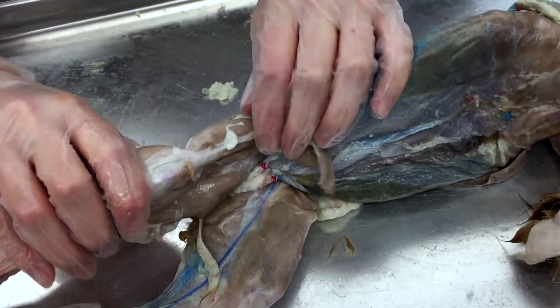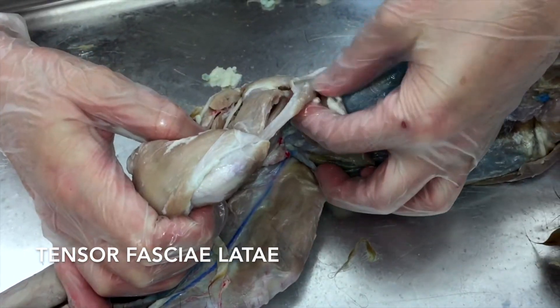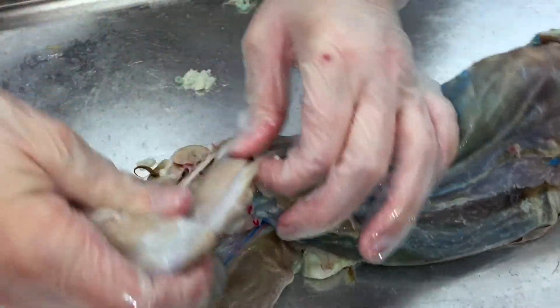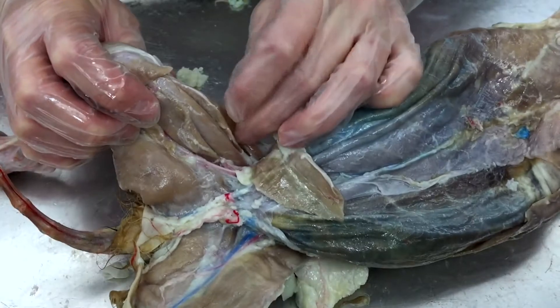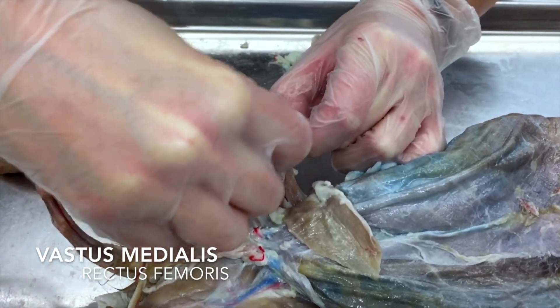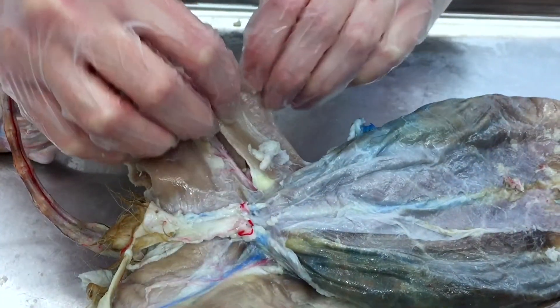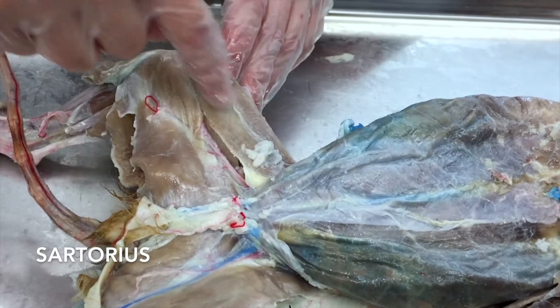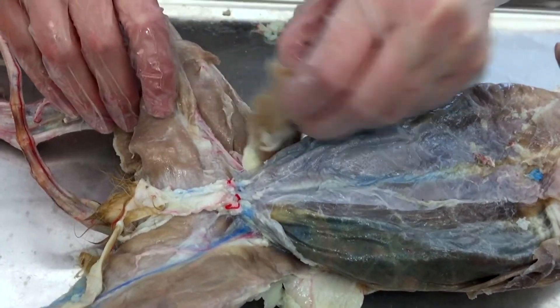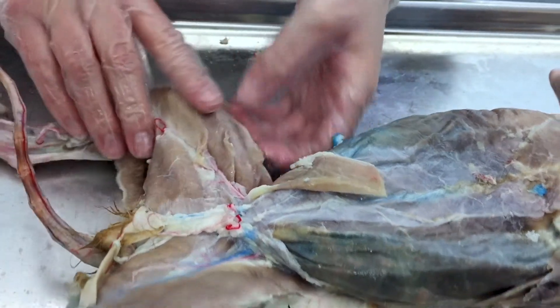Flipping to the front side, you can see a muscle with a big long piece of tendon attached to it — that's going to be your tensor fascia latae, just like in people, with the big piece of fascia. Getting it out of the way, you can see vastus lateralis wrapping all the way around. So vastus lateralis is the one I'm pinching, which means the one on the inside is vastus medialis, and the one in the middle is rectus femoris. To see your quadricep muscles you need to move the sartorius out of the way — you have to cut the sartorius and reflect it back, and then you can see your tensor fascia latae, vastus lateralis, rectus femoris, and vastus medialis.